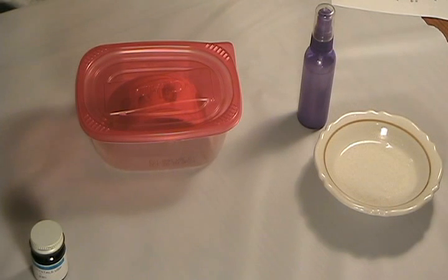If you don't have the Make Forensics kit, you can use ordinary drugstore tincture of iodine. Put about five milliliters or one teaspoon on the bottom of your fuming chamber and evaporate it with a hair dryer or a dish of hot water. You can save and reuse the fuming chamber without adding more iodine — we keep one on hand because it's also useful for developing chromatograms and revealing alterations in documents.